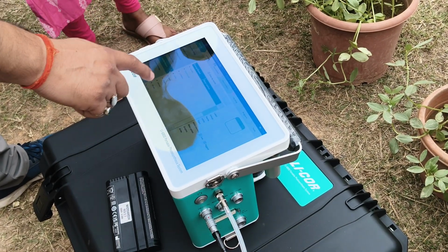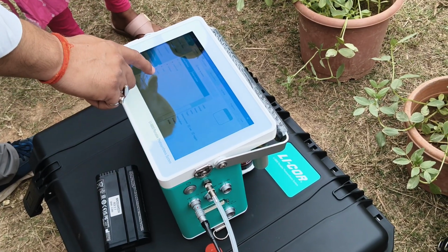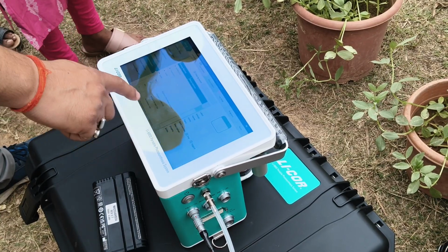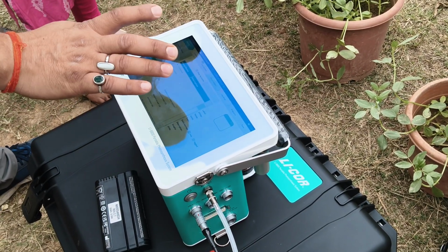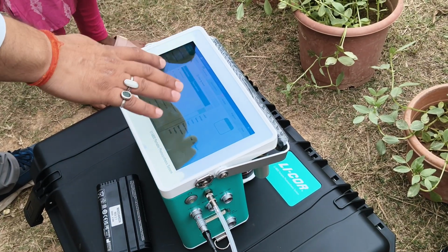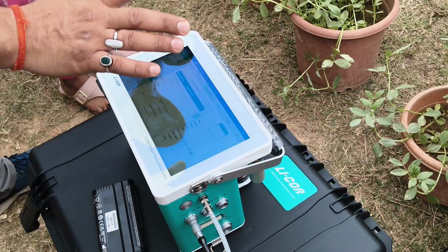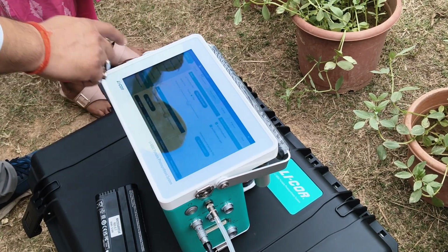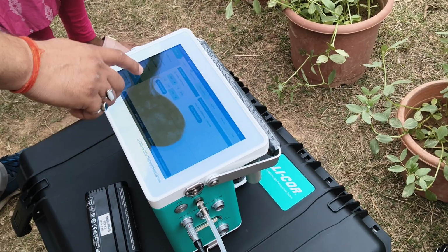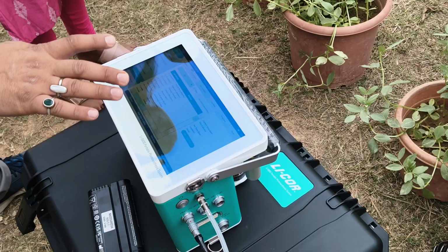Then there is a data dictionary. For whatever measurements are inside this instrument, you can get the details, like what is CA, what is PCA, what is A estimation. These details are also available in the manual and the online manual, but at the time of measurement you can also get them from the data dictionary. Then we go into the system settings. These are the basic things: date, time, brightness, time zone.